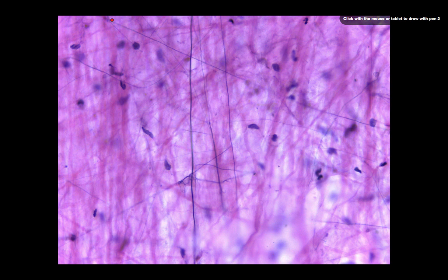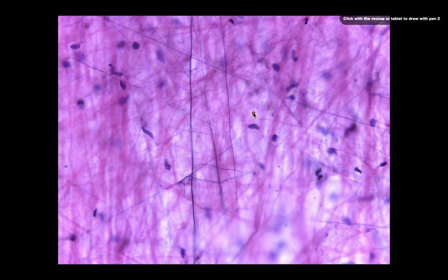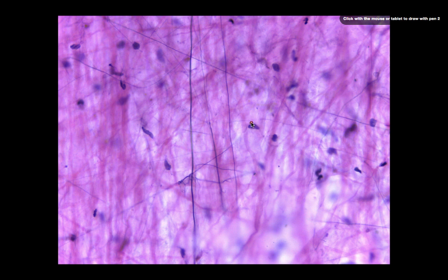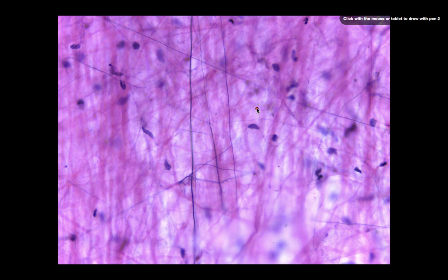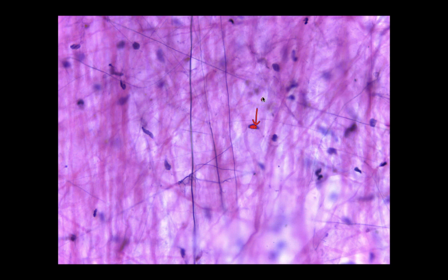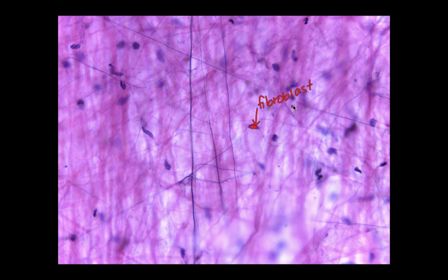Let's take a closer look at the next slide. This is also areolar connective tissue, but I just wanted to point out some things. Areolar connective tissue is going to be a proper connective tissue, and specifically it's going to be a loose proper connective tissue. Because it's a proper connective tissue, the cells that we find in it — which you can see right here, those are the nuclei — are going to be fibroblasts or fibrocytes.